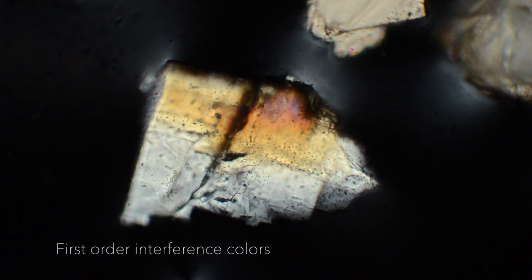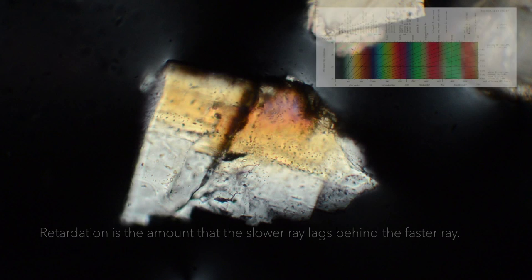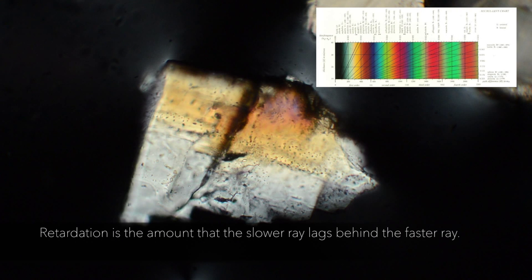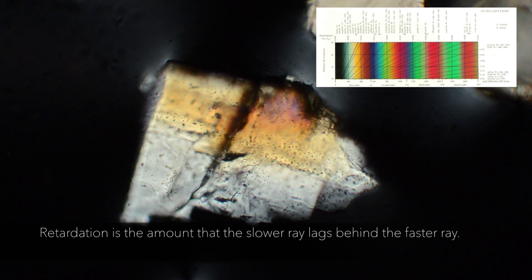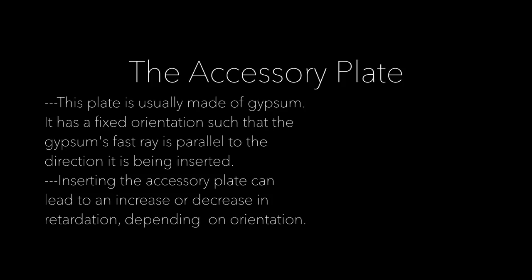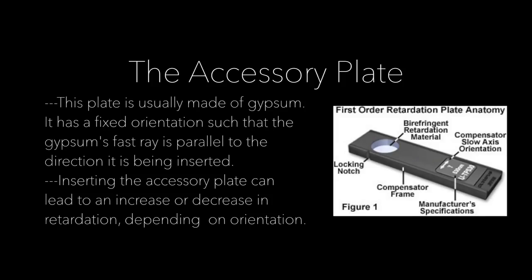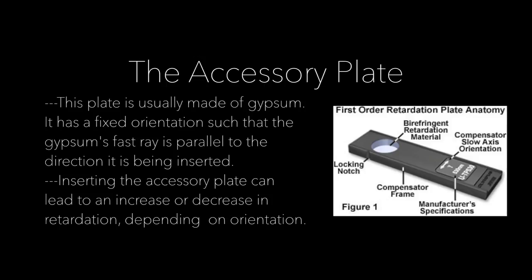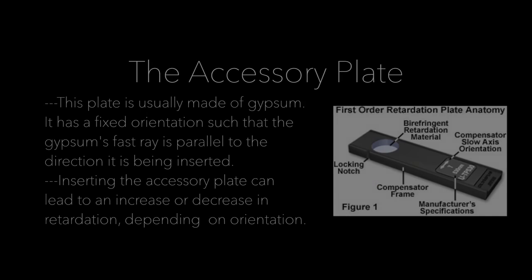Remember from the last video that interference colors are a product of retardation. Retardation is the amount that the slower ray lags behind the faster ray. In order to distinguish between the slow ray and the faster ray, we use an additional tool called the accessory plate. This plate is usually made of gypsum. It has a fixed orientation such that the gypsum's fast ray is parallel to the direction it is being inserted. Inserting the accessory plate can lead to an increase or decrease in retardation depending on orientation.